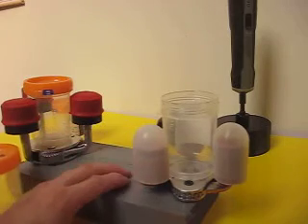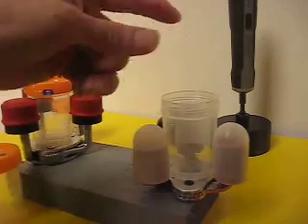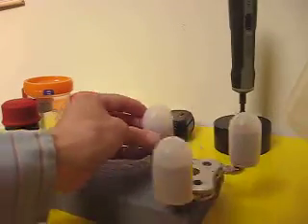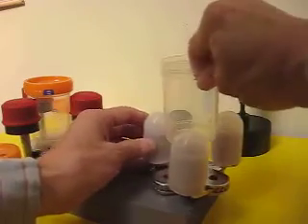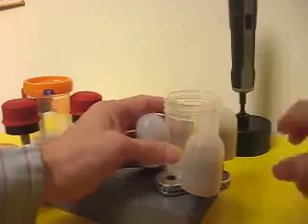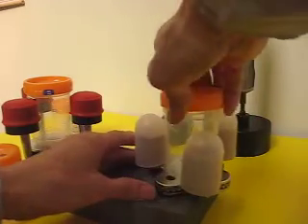And then if you want to do the capping, you just turn the other way around. That's capping, capping.